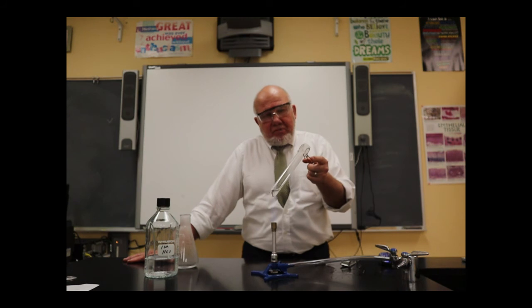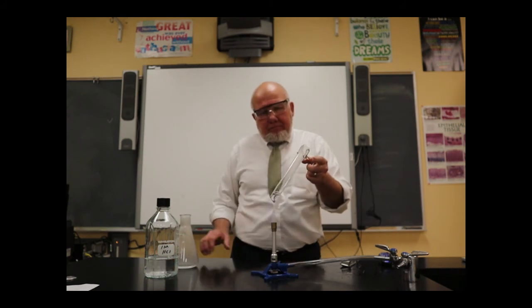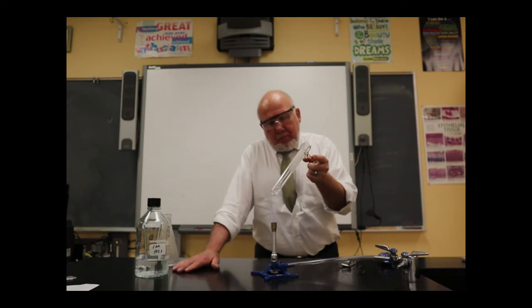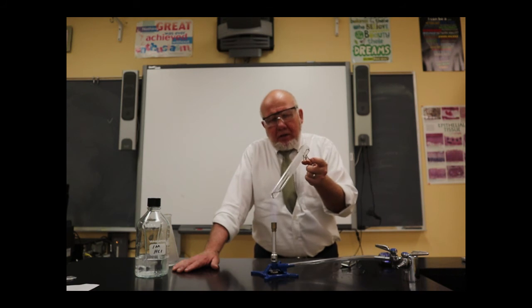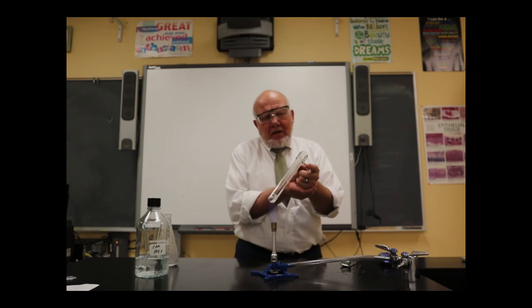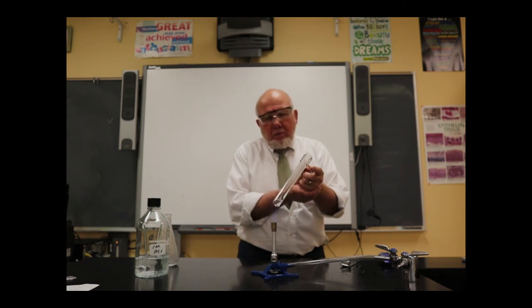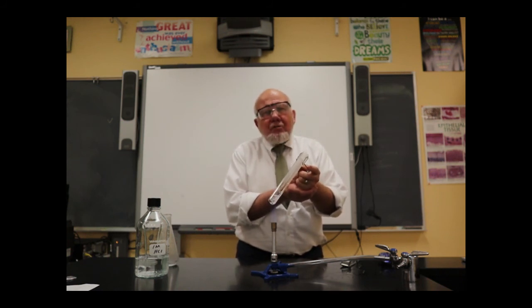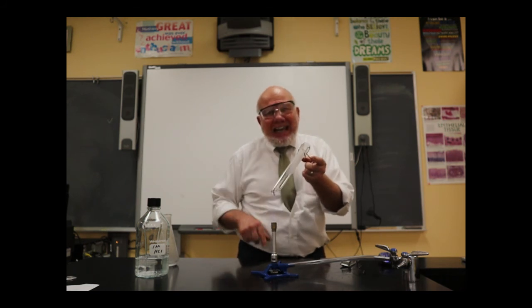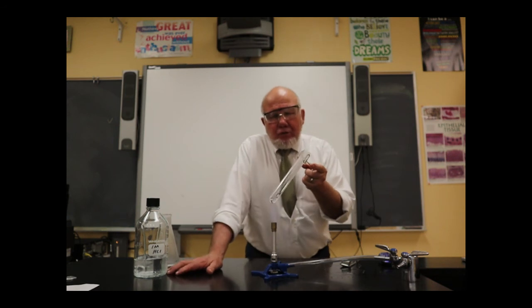So you can see steam coming out of this top here. Obviously I'm going to have to do this again if we're going to see what kind of results. I wanted to see what kind of percent yield I'd get. I wanted to see if I could actually show you that you could probably calculate the grams. But at this point, what we want to do is demonstrate to you that the magnesium metal, the magnesium atoms, are there in the liquid, that you have formed a compound.